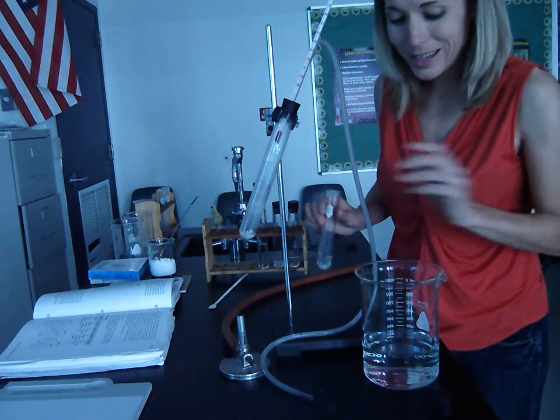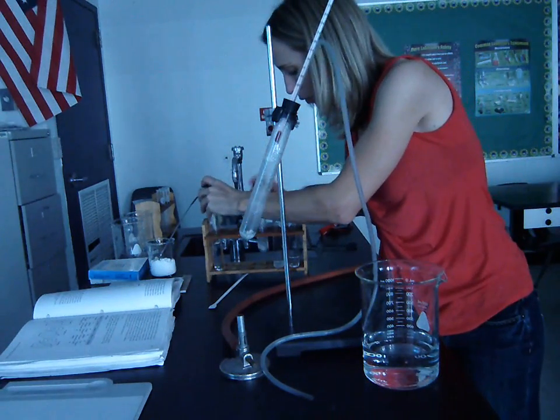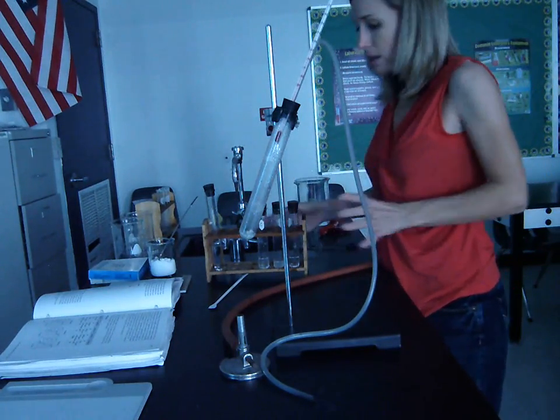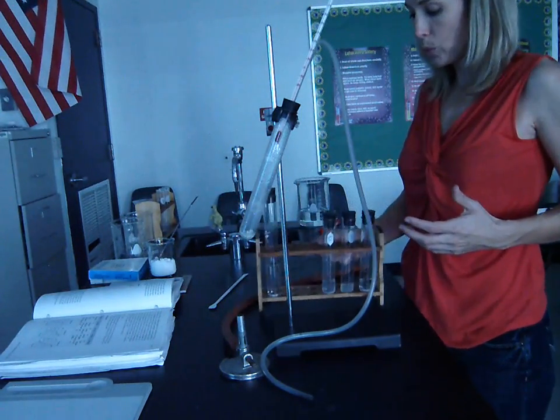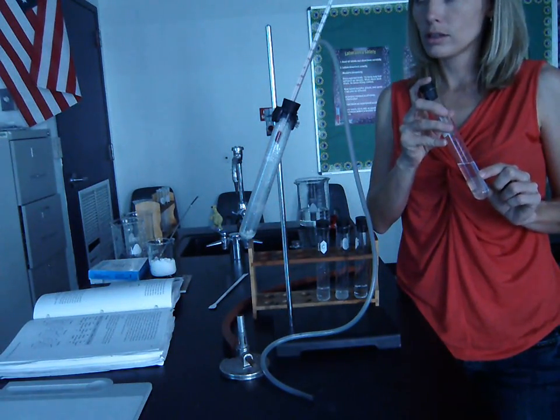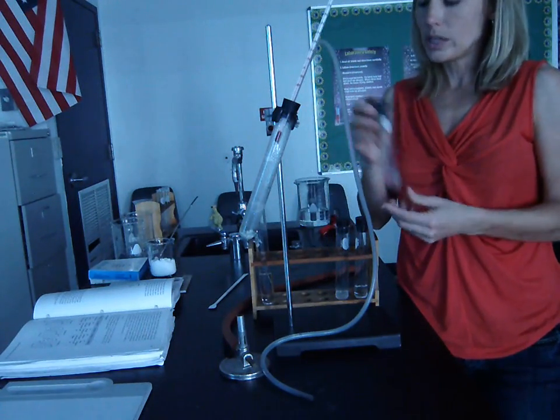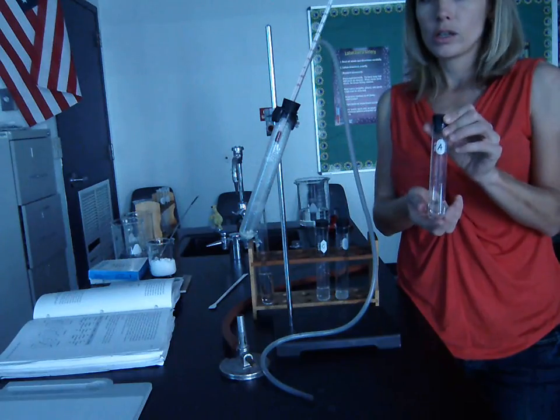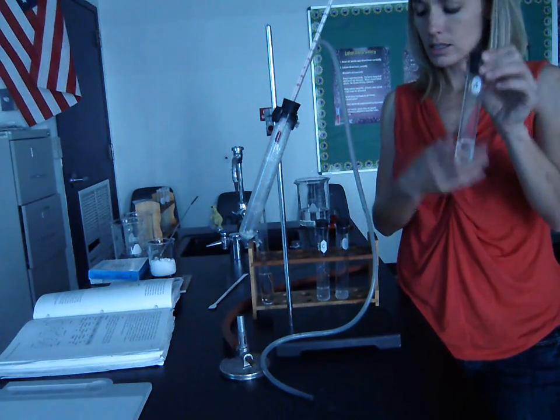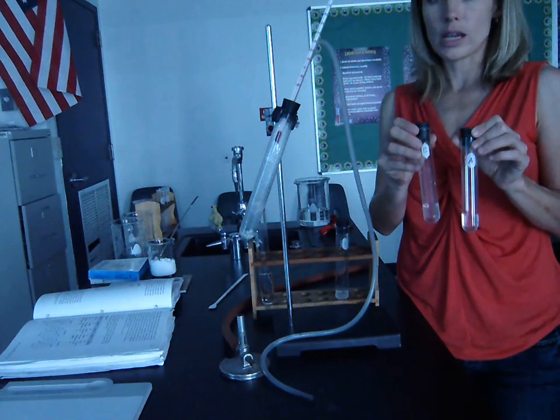And now we can assess what are called our fractions. So let's talk about this for a second. Actually, before we talk about the fractions, essentially what we've done at this point is we started with a mixture of two liquids. We took the mixture, we heated it to where it boiled. We then boiled off part of the mixture, the liquid that boils at 80. That's in this test tube. And we've separated it completely from the liquid that boils at 100.